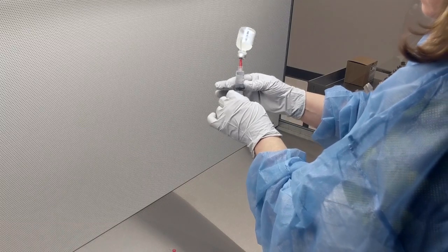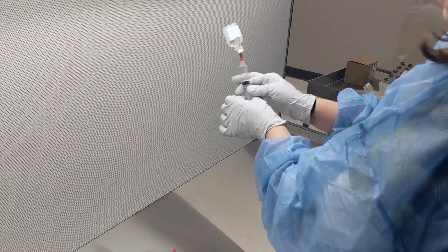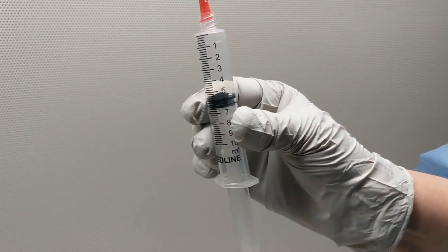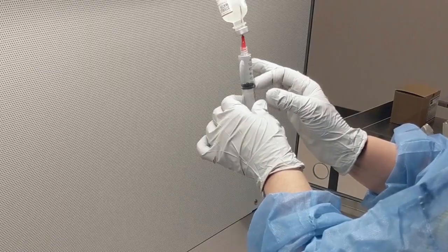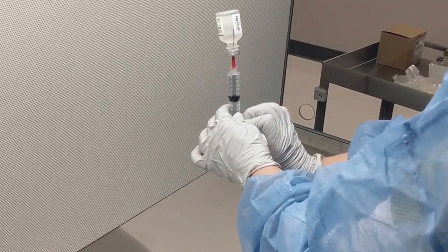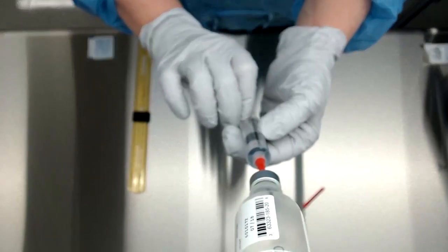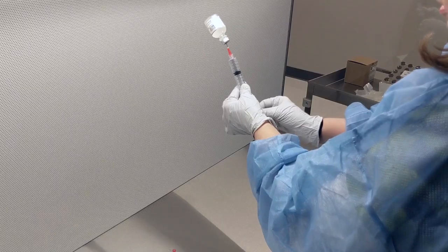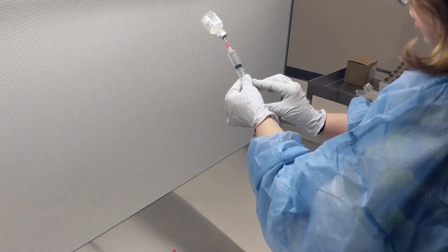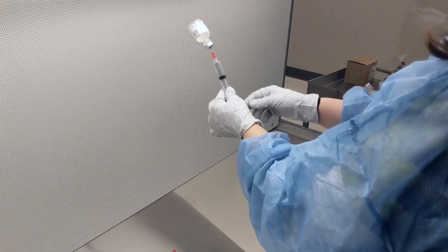The way we're going to get rid of the bubbles—we're going to put more air in. If these are tiny little bubbles, that's not a problem, those are not of significance. But if there was a big bubble, this is how you would do it: you pull the air into the syringe and tap on it until all the bubbles pop up to the top. They will join the top bubble, and then we're just going to push it back up. Now make sure your needle is in the fluid. We're above the five, so I need to pull down more. I'm going to pull down a little bit more. Sometimes it's easy to go past it, then you can go back up to where it is. There we go, so now I have five milliliters in here without substantial bubbles.